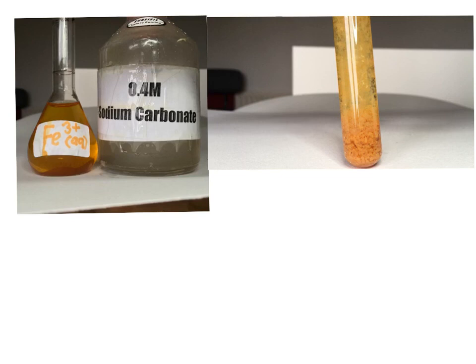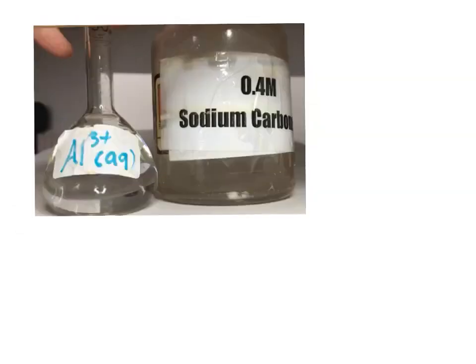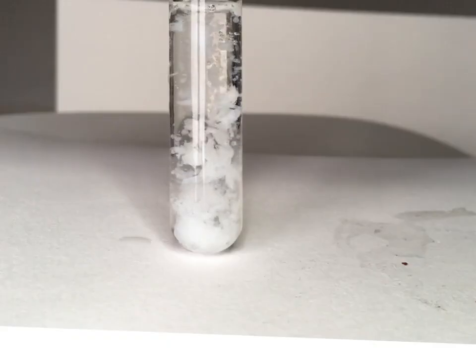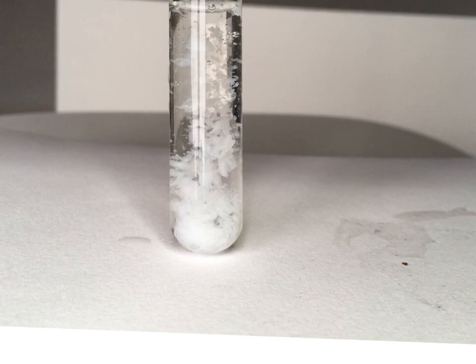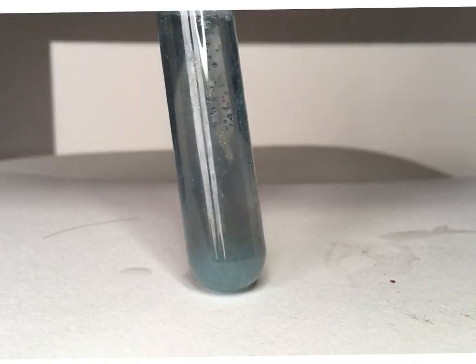So let's now look again at iron 3 ions, aqueous iron 3 ions reacting with aqueous sodium carbonate. So we can see clearly that when the two are added, you're getting a precipitate and the effervescence that you can see in the tube as the carbon dioxide gas is coming off. Let's see that again with aqueous aluminium ions. A precipitate of aluminium hydroxide and carbon dioxide effervescing off. And finally with aqueous chromium 3 ions, we can see clearly the precipitate of chromium 3 hydroxide and effervescence as carbon dioxide gas is evolved.